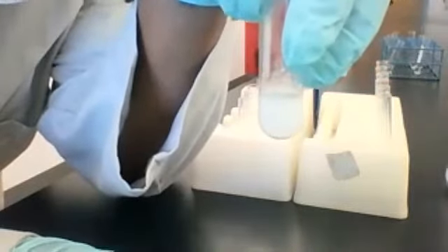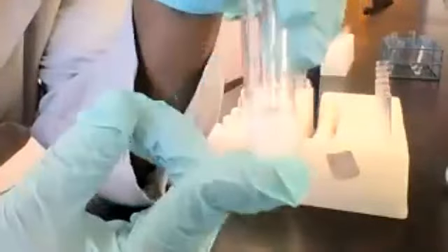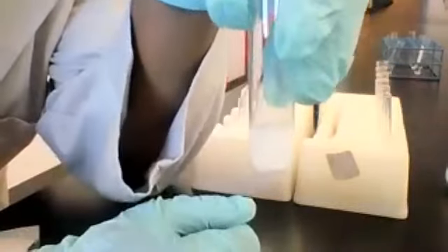So that first row in table 1, where NaCl and AgNO3 are set, you are intended to write your observations in that space. For this one, you can write that you see white precipitate forming. You can abbreviate precipitate with PPT, because I know that square is pretty small. And you can just write PPT, because that's what we see here.